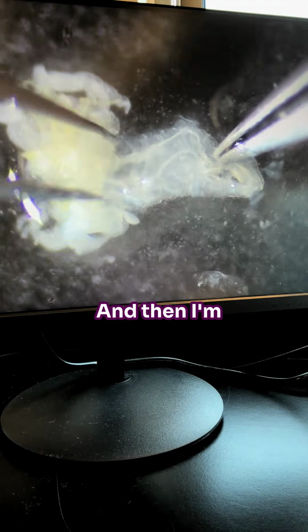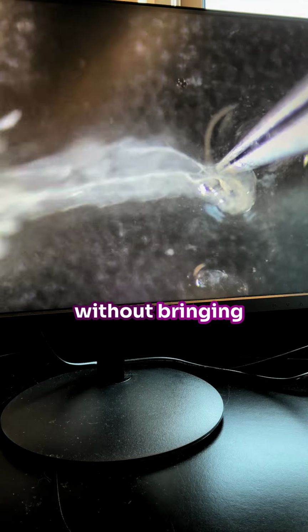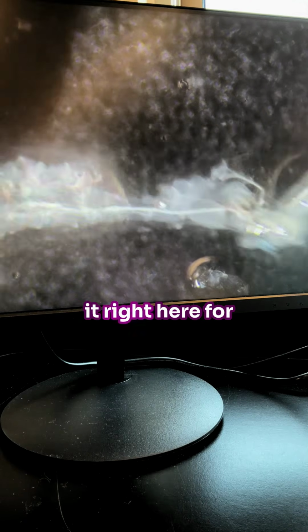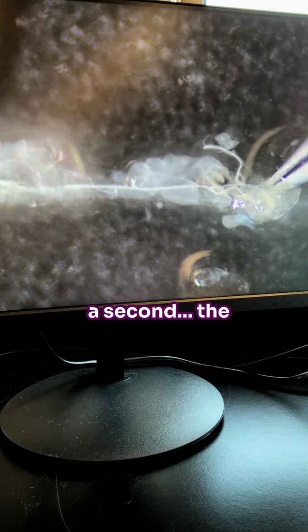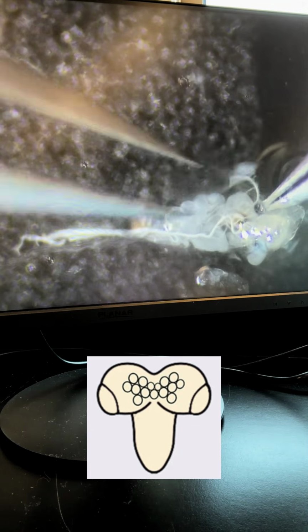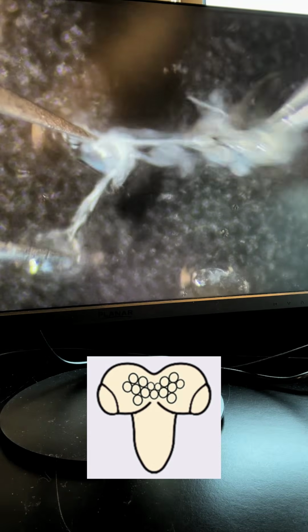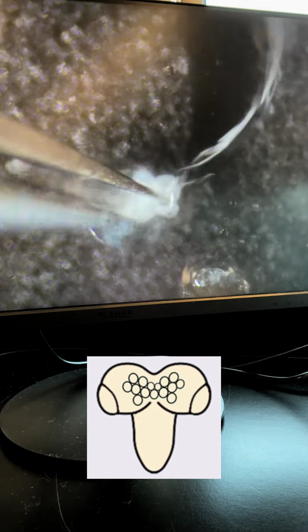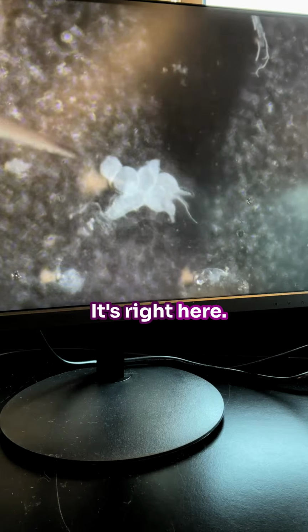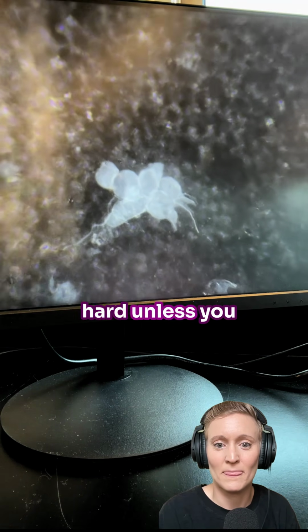And then I'm basically trying to tease out what's right here without bringing other stuff. Hang on. So I'm going to hold it right here for a second. The brain looks like two Mickey Mouse ears and a tail. And so in this glob, it's right here. Wow. So it's really hard unless you know what you're looking for.